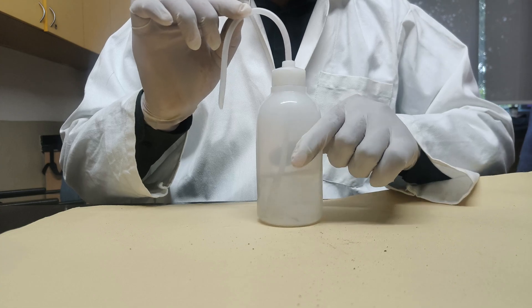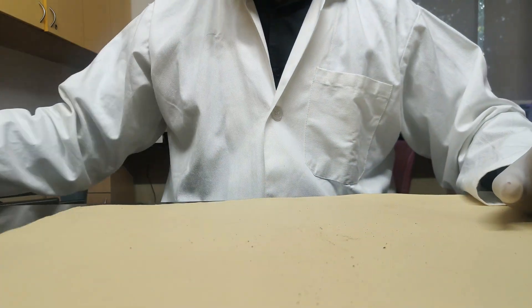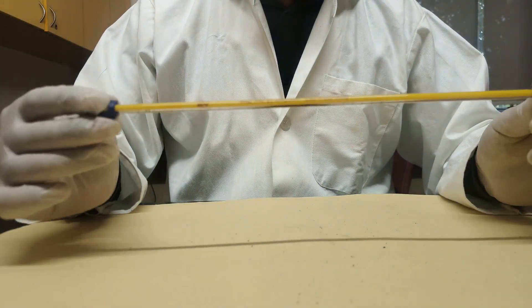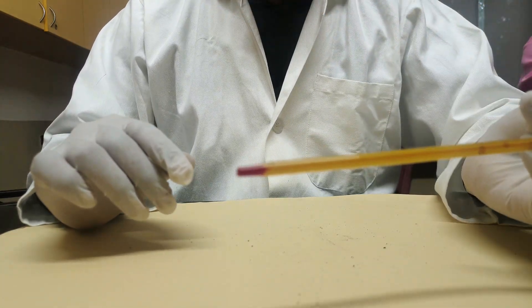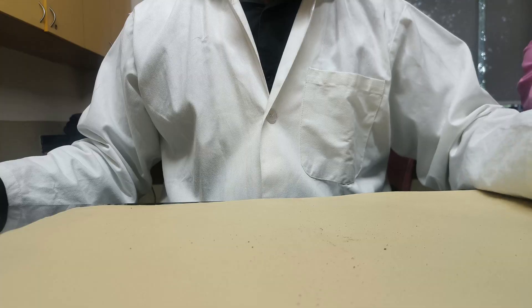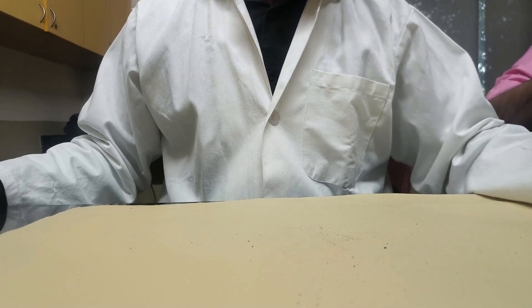Next is the wash bottle. It is used to contain distilled water in the lab — it is a pure source of distilled water. Next is the thermometer, which comes in two types: mercury and alcohol. The red tip at the bottom indicates an alcohol thermometer. It is used to measure the temperature of any chemicals while heating.